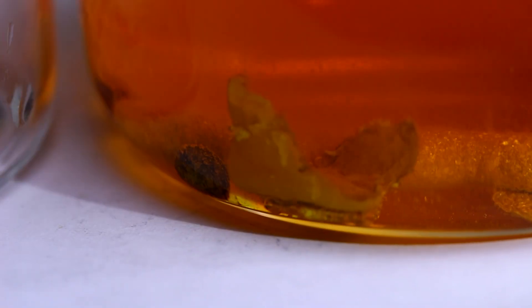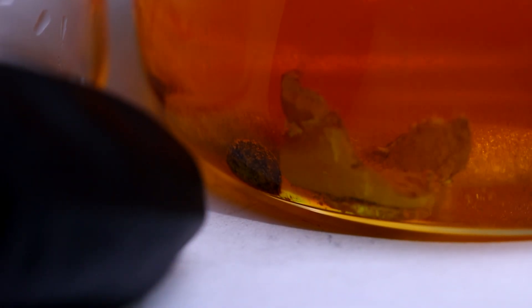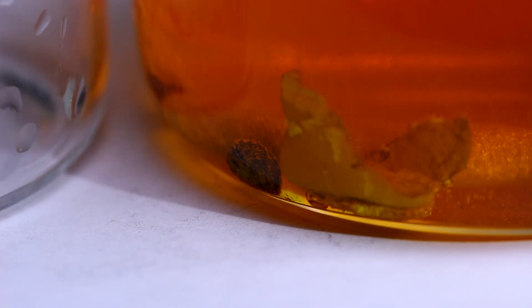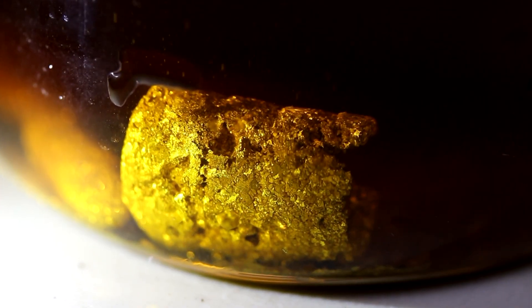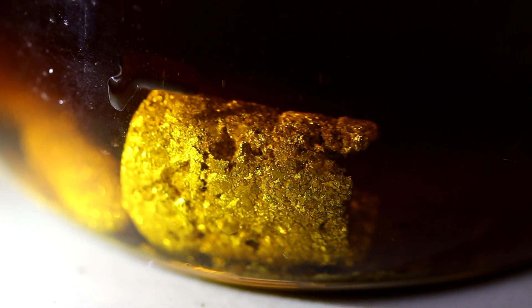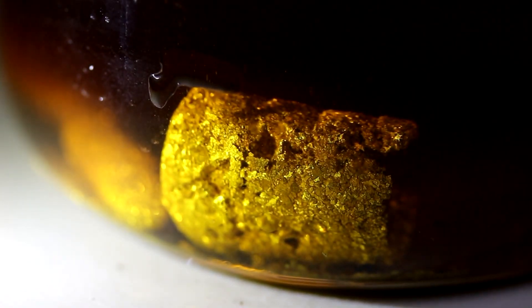You got this little bead over here which has turned dark. This is the bead that came out of the mercury. I think what actually happened there is I used an old crucible and it must have had a little bit of silver or something in it. It looks like it is dissolving, just more slowly. This bullet's been dissolving in the acid for a little over an hour now — you can see those huge crystals getting exposed.